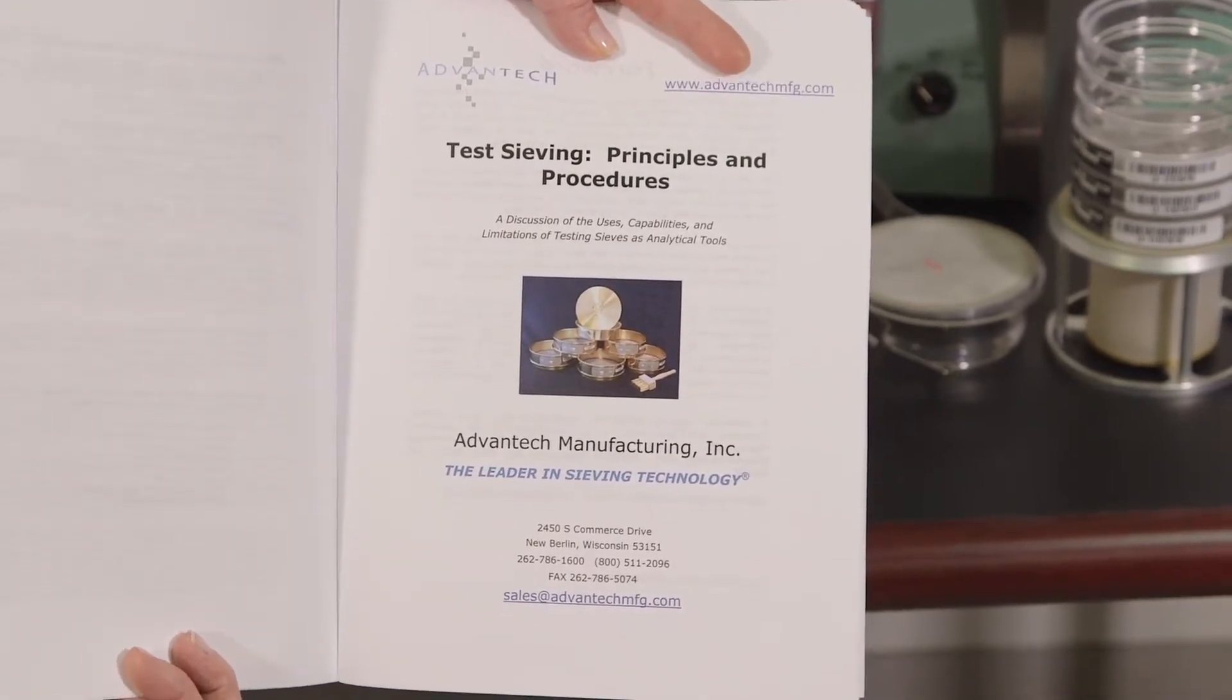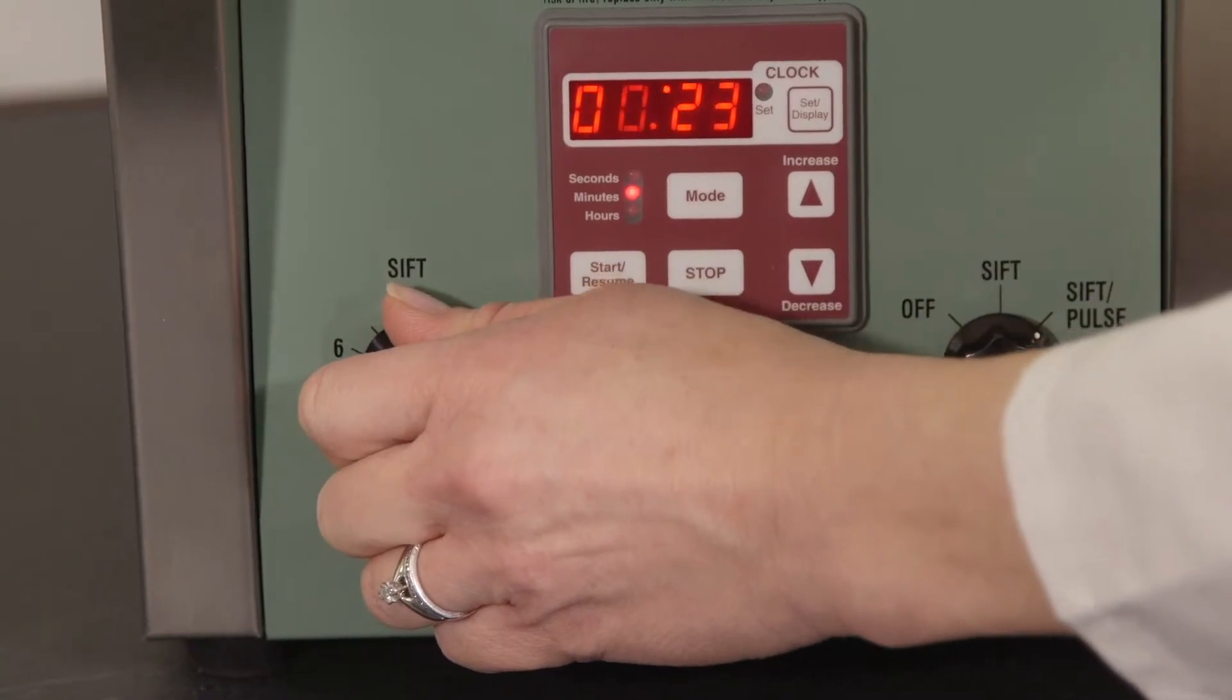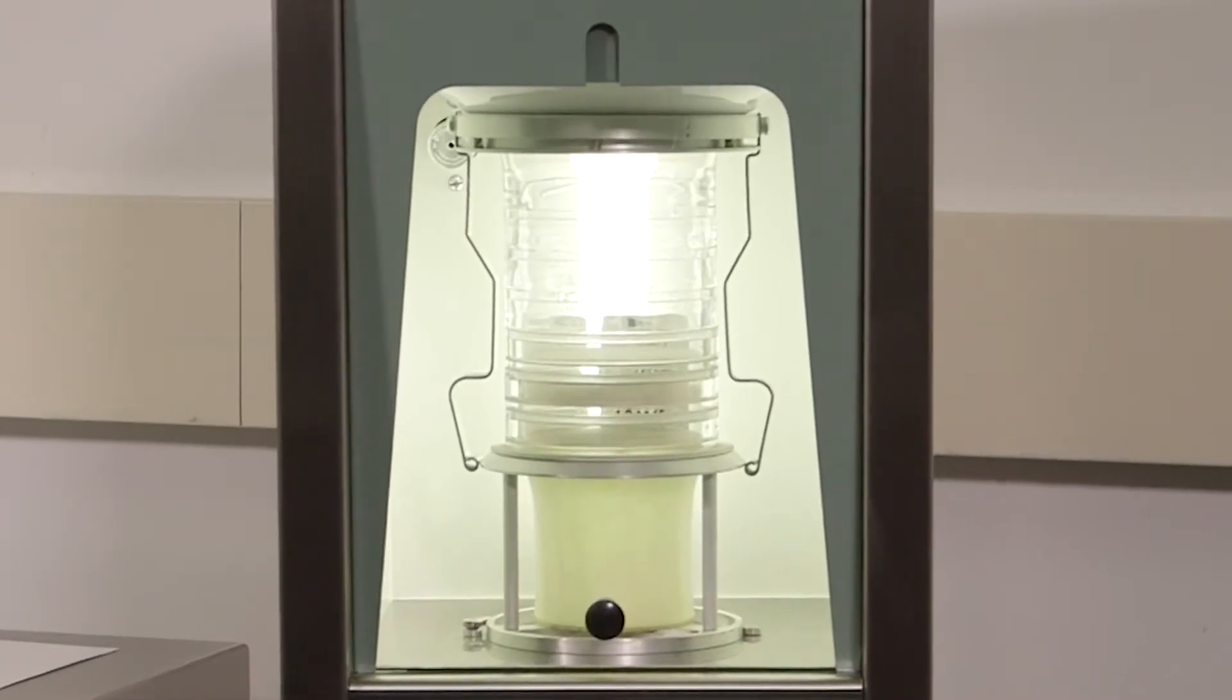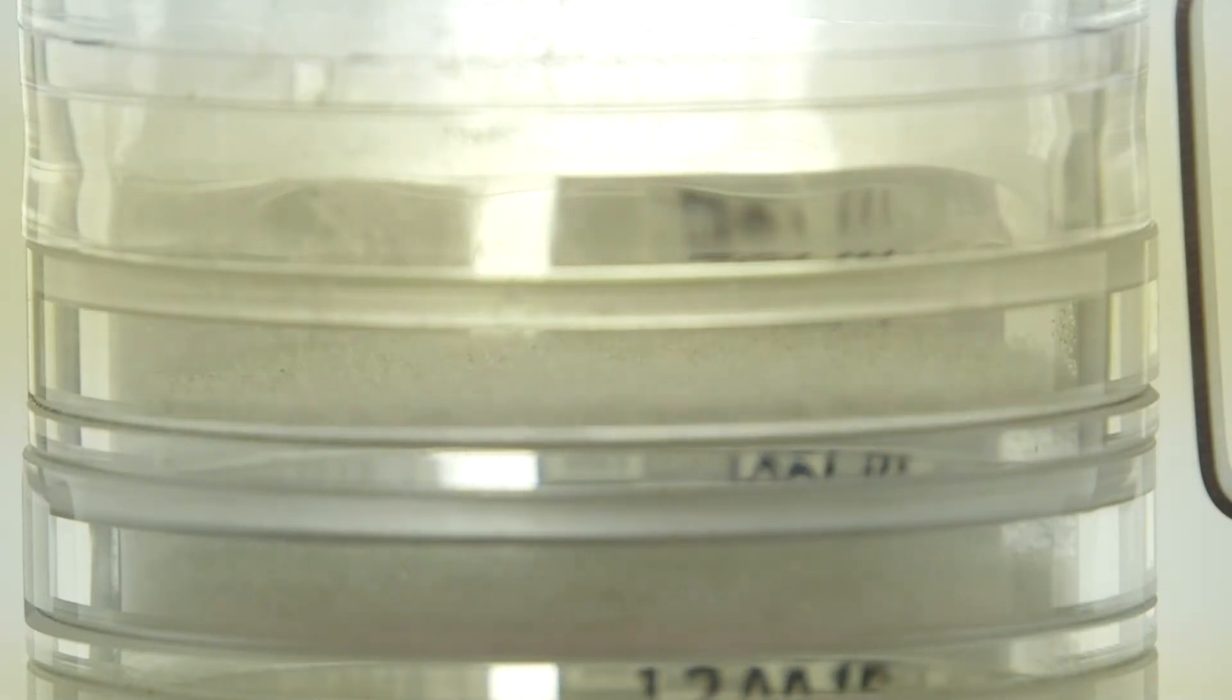Once your time is set, hit start. If you are unsure of how long your test run should be, refer to our test sieving principles and procedures manual located in the back of your operation manual.